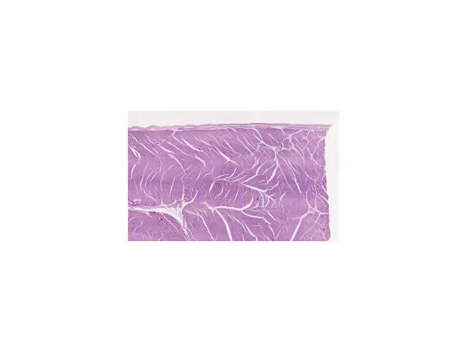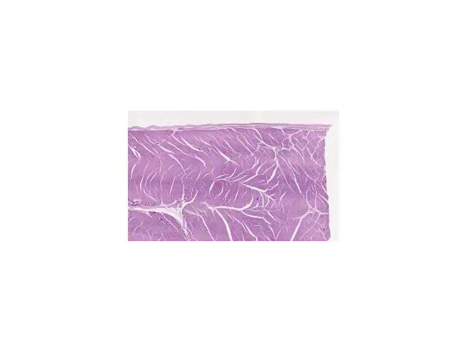Although histologically the heart is a simple three-layered structure — composed of an endocardium (which is endothelium, same as lines blood vessels, sitting on some connective tissue), a myocardium (made up of cardiac muscle), and an epicardium (made up of generally connective tissue and fat through which the major vessels supplying the heart run) — it can be quite complex because of the size and geometry of the organ to understand histologically. We're not going to attempt to understand the entirety of the heart, but we will try to understand the basic components that make it up.